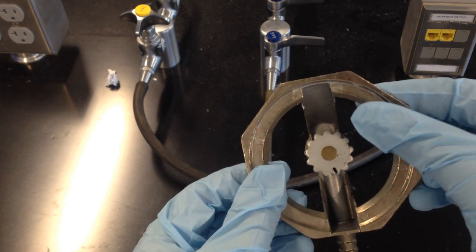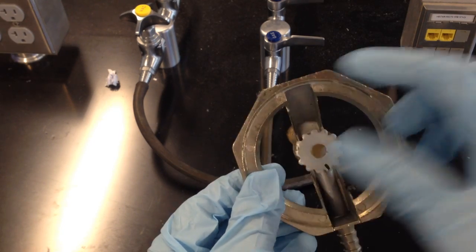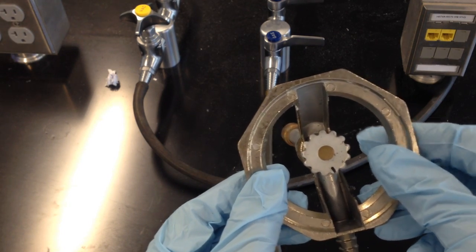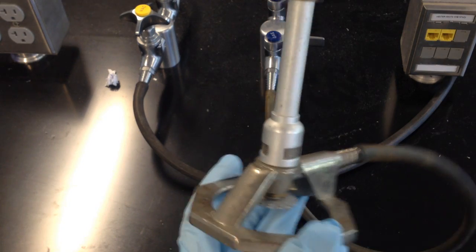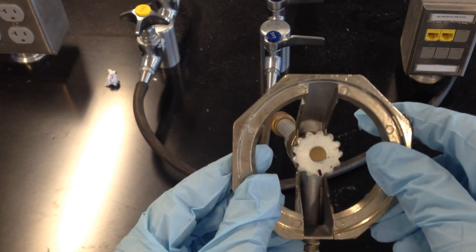On the base, at the very bottom, you'll also notice another valve that kind of looks like a sprinkler head, and make sure this is turned all the way to the right so that it's completely off. At this point, no gas can flow through this device because this bottom valve is completely closed off.